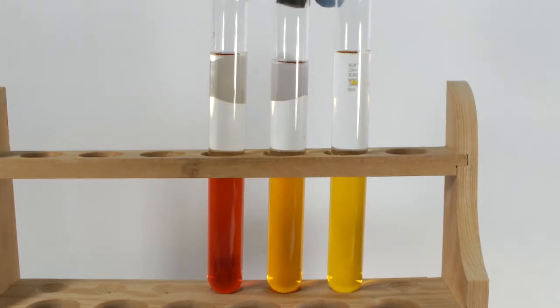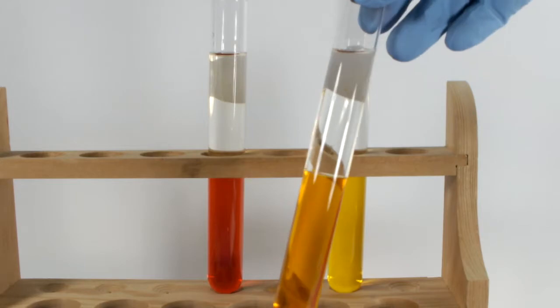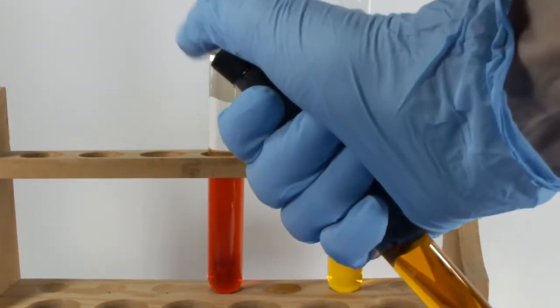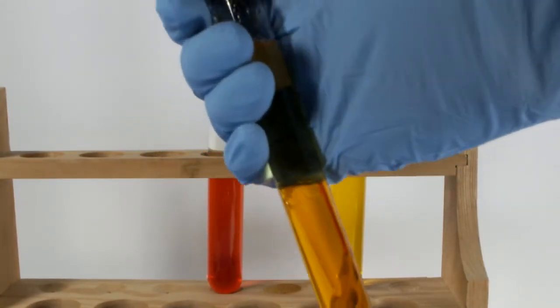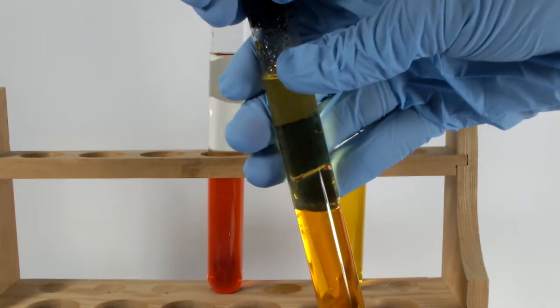I'll start with the untreated one to see how much of the dye tends to migrate when it's just water versus petroleum ether. Make sure the cap's on tight there. Petroleum ether is pretty volatile, so I'm actually a little bit nervous to take the stopper out in case too much pressure built up. It's fine though.